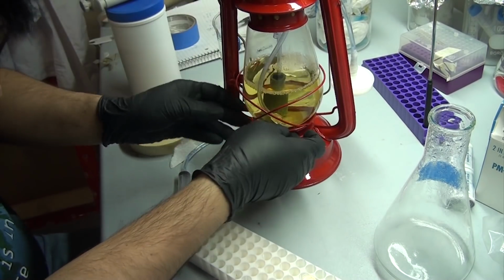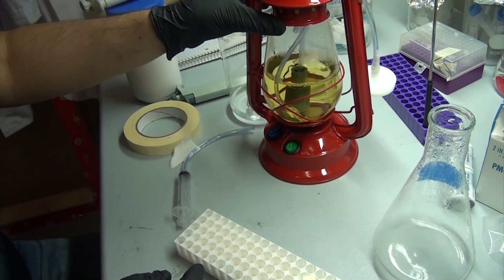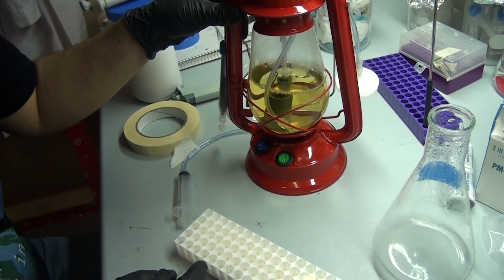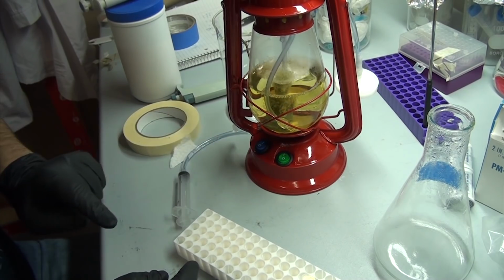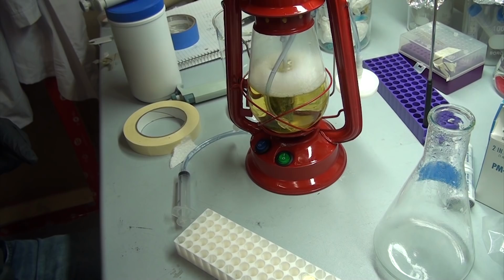In this video, we're going to go through the build process of the reactor itself, and then in a future video, we'll build a small pumping unit to allow that infinite production I mentioned before. I've got some fun ideas for that once it's built, but that's a topic for another time. Today, we'll just build the basics and give it a test run so that way we can come back to the bioluminescent bacteria in a couple of weeks.